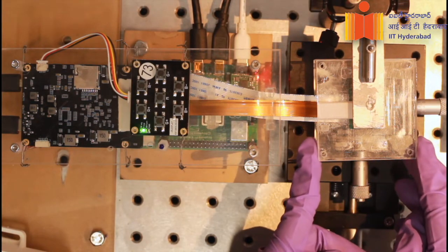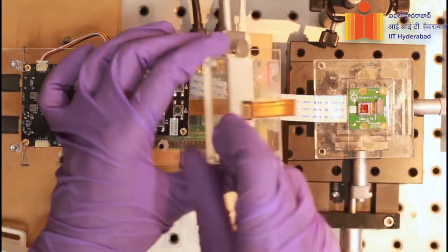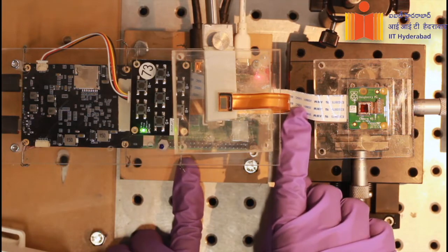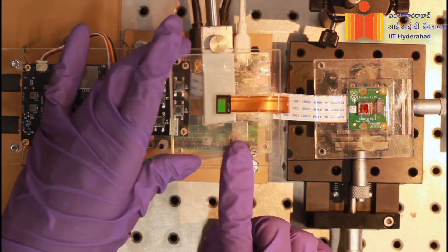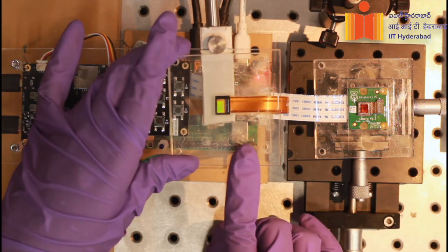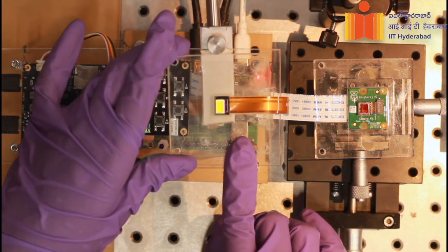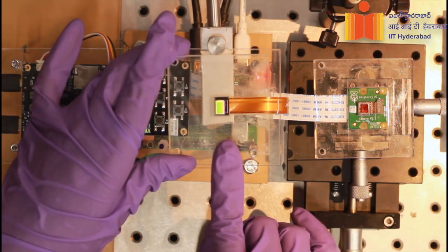MuScope comprises two electronic chips. The first is a camera sensor chip, connected to the single board computer through a white flexible cable. The other chip is a micro LED display chip, which is the key component of MuScope. The micro LED display is a small chip comprising a rectangular array of LEDs, each of micron dimension and bright enough to be used as a light source. The actuation and brightness of each LED can be controlled individually.